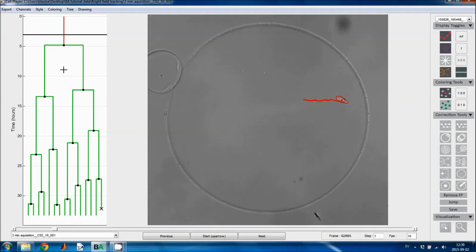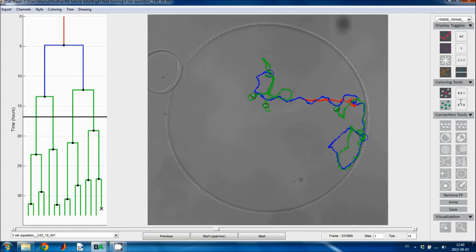In this case it's red, so I'll just click on this cell, and then I've colored the first generation of the lineage tree red. Now if I want to color the second generation blue, for example, I can enter blue here, 001, and then I click on the cells. The cells become blue. And now I can make the 4th generation yellow. So this can be useful if you want to highlight something in a figure for a paper or something. And then if I want to go back to the normal coloring, I just use the coloring menu.